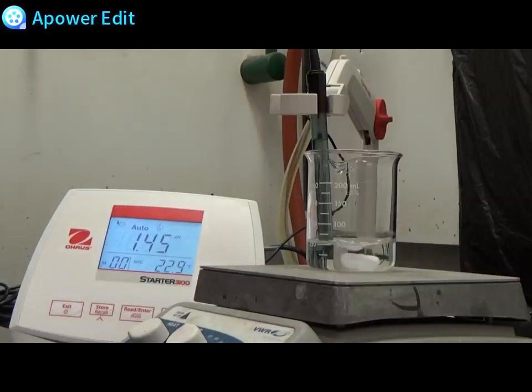At no addition of sodium hydroxide, we have a pH around 1.46. My first point will be 0.00 milliliters.